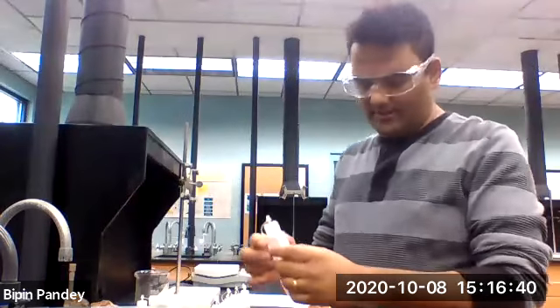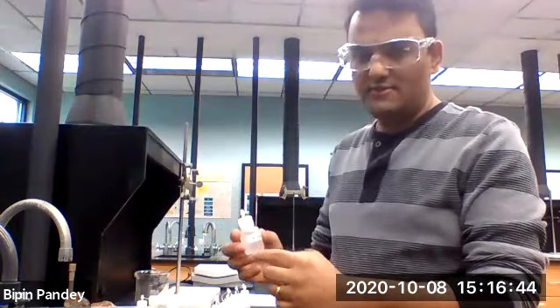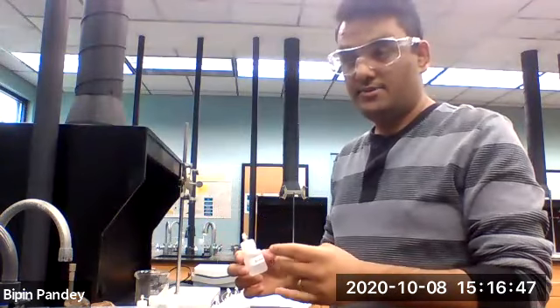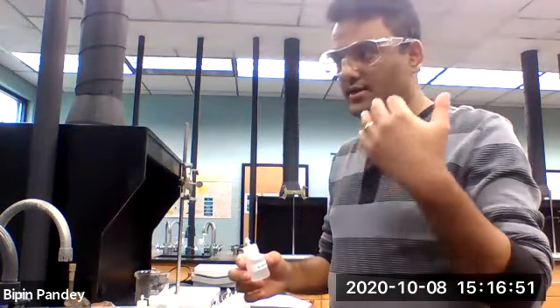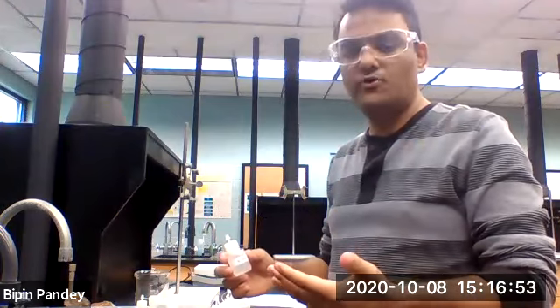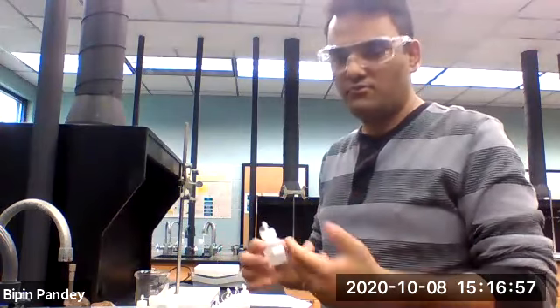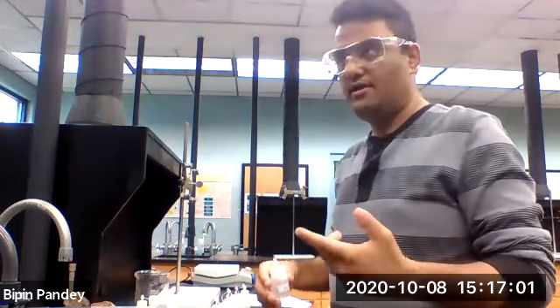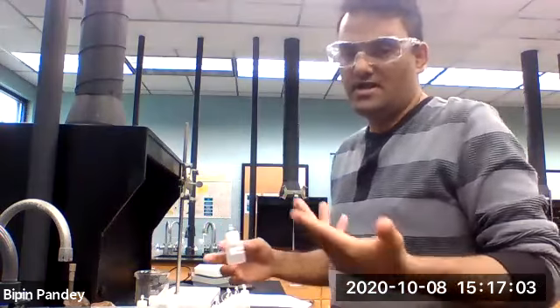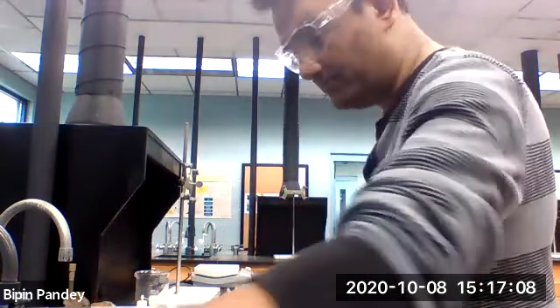Alright, so we are going to test sodium cation next, and we already did lithium and potassium, and we did not observe anything. And we know that lithium, sodium, potassium are in the same group, so you should be able to predict what happens with sodium, because lithium and potassium did not give any reaction, right? So let's see what happens.